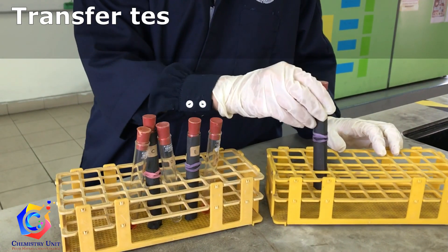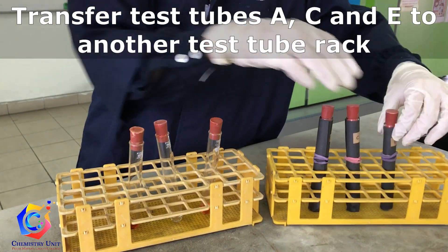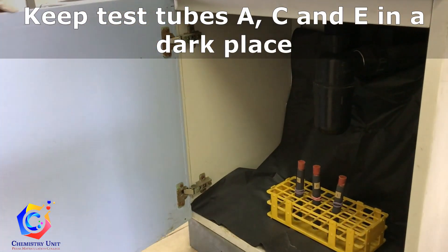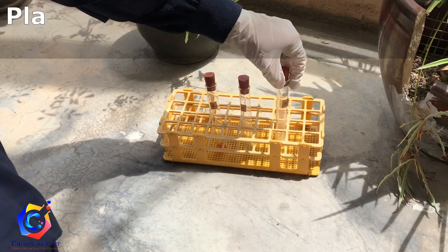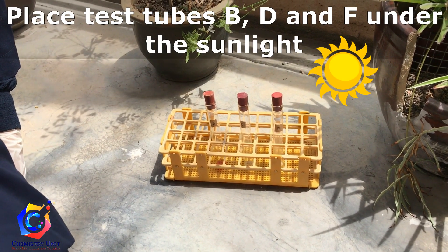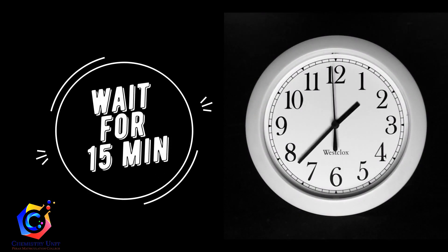Transfer test tubes A, C and E to another test tube rack. Keep test tubes A, C and E in a dark place. Place test tubes B, D and F under the sunlight and wait for 15 minutes. However, this depends on the weather.